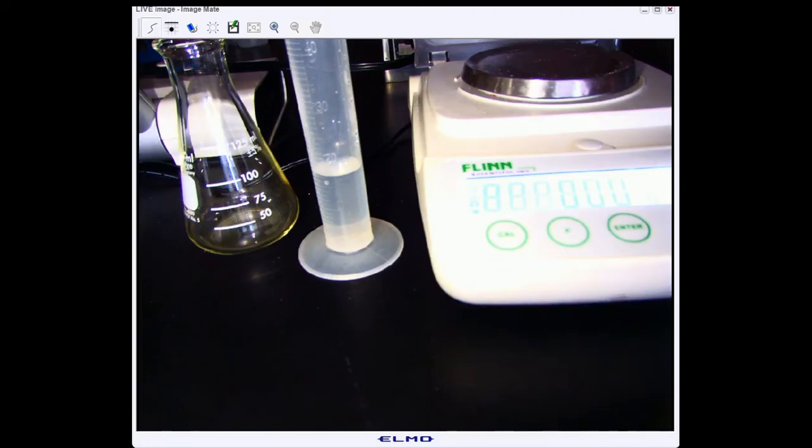This video is going to walk you through how to do the conservation of mass lab with baking soda and vinegar on the off chance that you missed it.